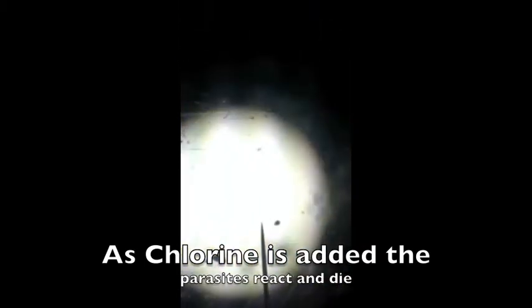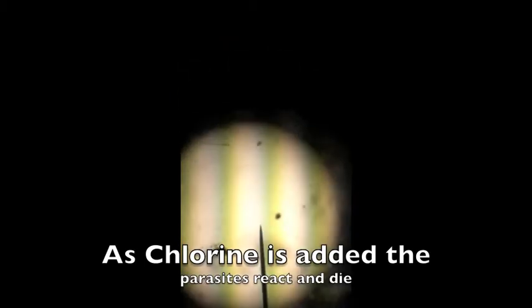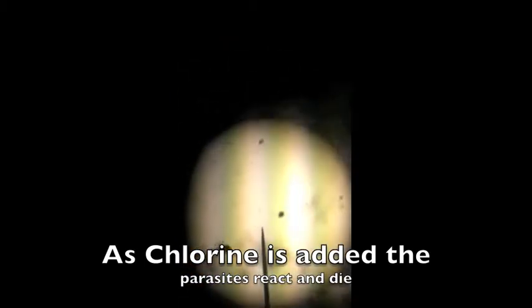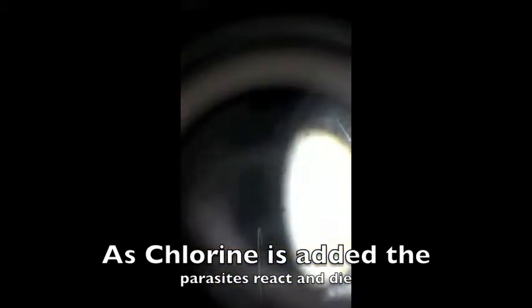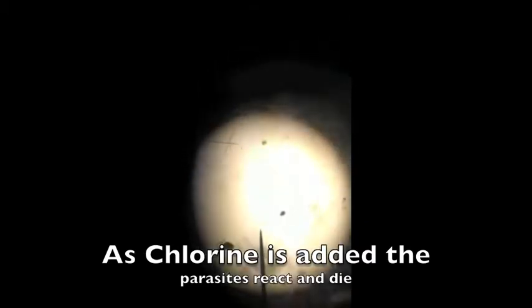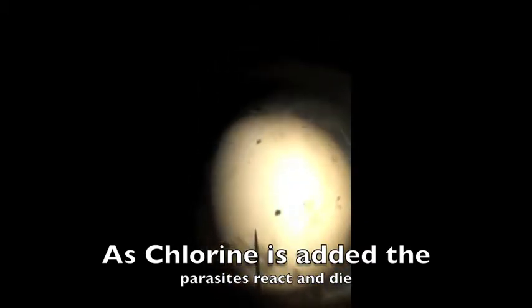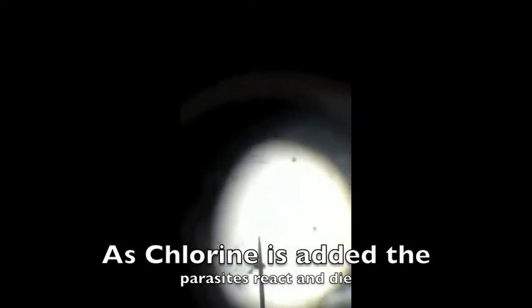Ready. Go. Two drops. More. Keep going. You're really excited then. Did it vanish? They're all stopping. Maybe they're dying. That's what I believe. One's just spinning in circles. Another drop? Yeah, keep going. One more drop. Put it all in there, Tim.